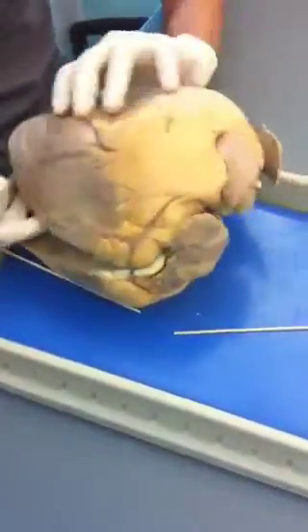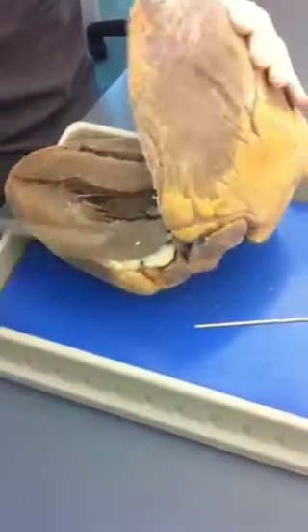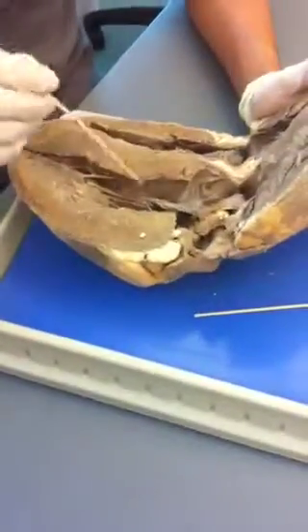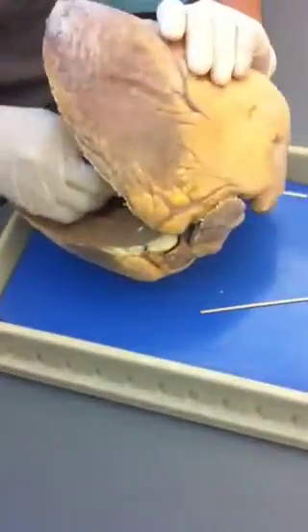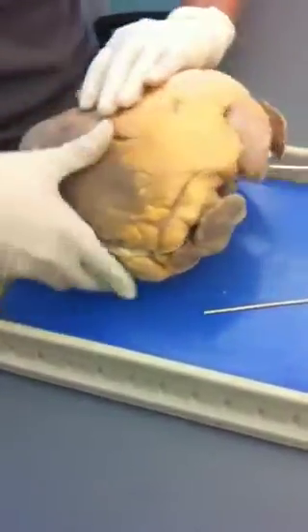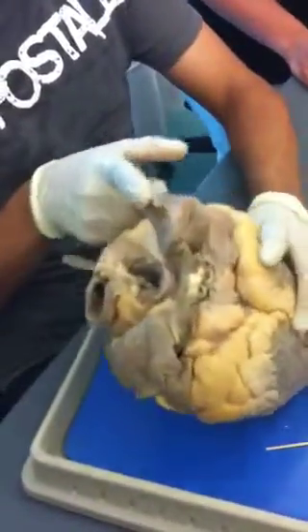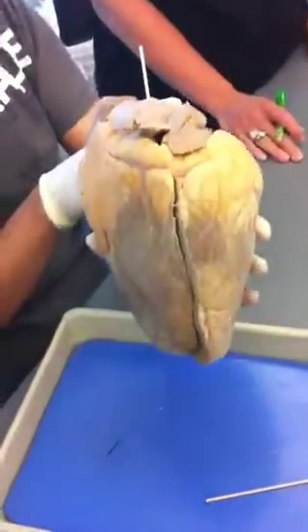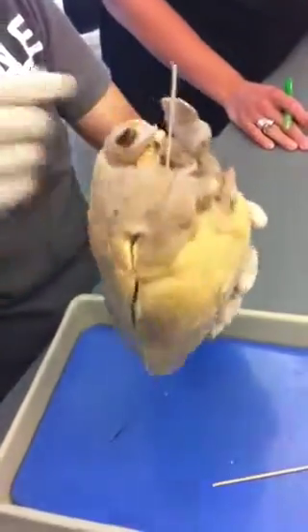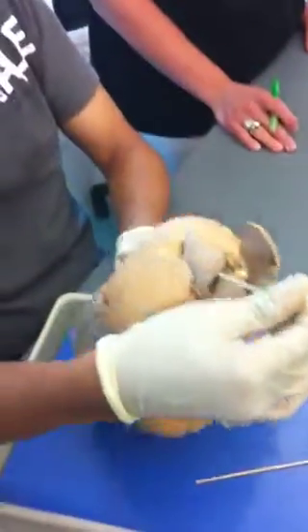Now to identify the pulmonary trunk and the aorta. You know that this is the left ventricle, so follow that vessel — you can see where it's coming out. So that's the aorta. And this vessel over here is the pulmonary trunk.